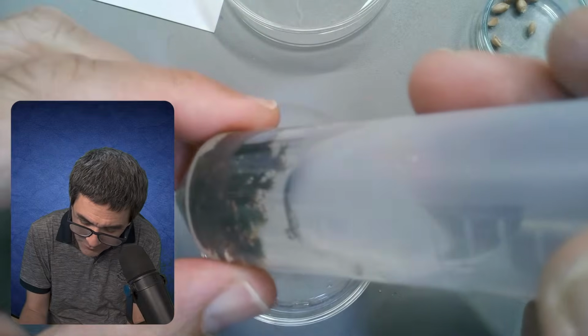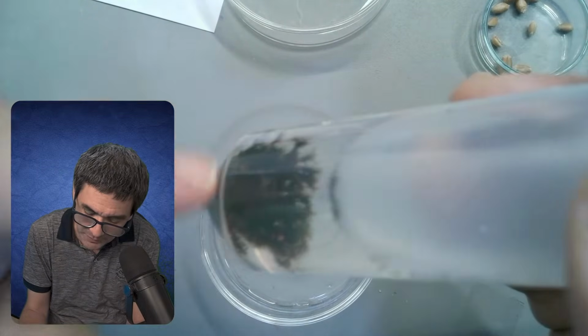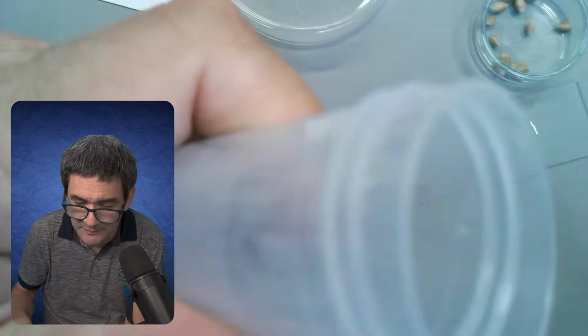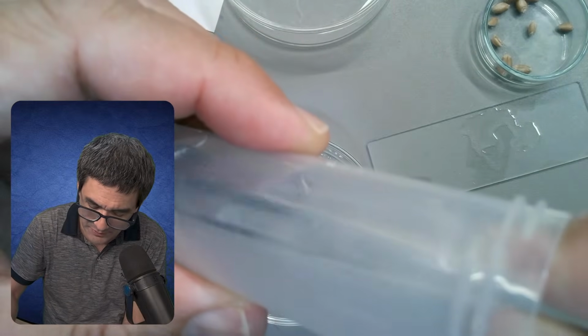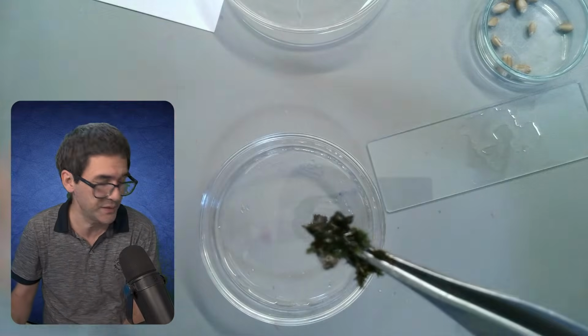The question is now the following. What about this here? I'm going to take this out, and I'm not always very positive about finding something interesting.